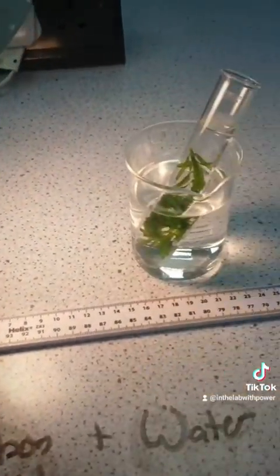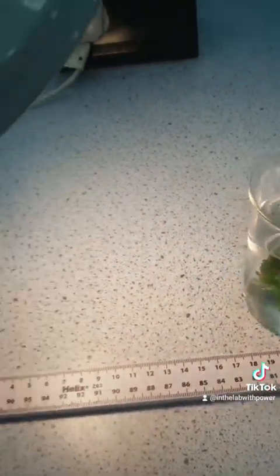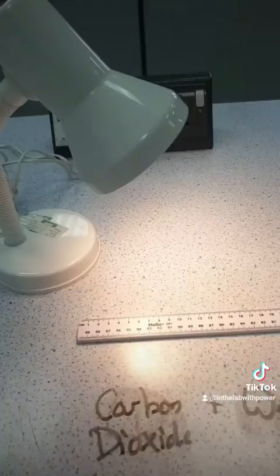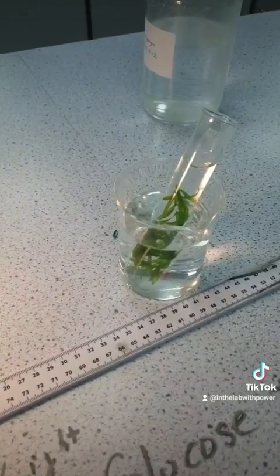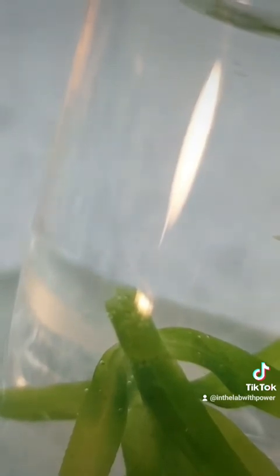We then move our Elodea 10 centimeters back, and that will make the light intensity less, and let's see our result. And we can see as we've moved farther back, the light intensity has gotten less, and the rate of oxygen production has gone down slightly. Still quite high because the light intensity is high, but it has gone down slightly. Now we moved our Elodea far back, low light intensity. Let's see our results. And we can see that the number of bubbles being produced has gone down yet again.